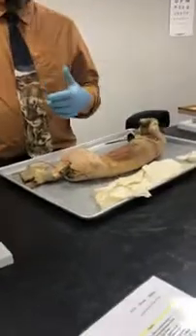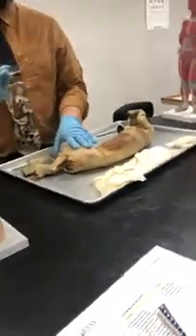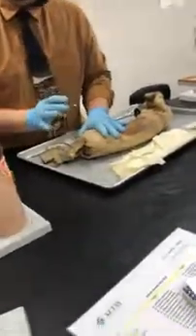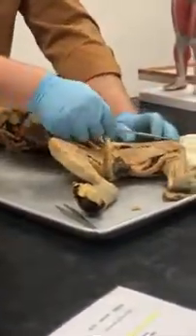What we did over here is that the gracilis is covering these two over here. And our gracilis is much thinner than the cat's. That's what's throwing you off a little bit. But they're in the same place. Okay? Now, let's do it on the cat. Do the same thing. Okay? So, let's just do it this way. So we have, what is this one here?